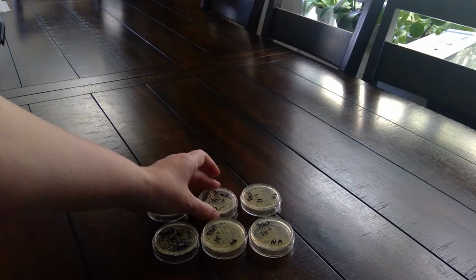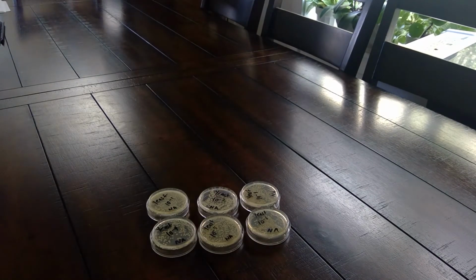Since these were inoculated twice, I would assume that the first time we wouldn't see growth because we weren't seeing growth after 2 days, but it's possible it was just slow because I also had to move my plates to a warmer part of my house. But I think the main issue was that the water that I used to activate the yeast wasn't warm enough. Just a reminder, you'll want to use your thermometer when you are getting water to activate your yeast. You want the water to be between 40 and 45 degrees Celsius. For me, the hottest my tap water got was 38, so I had to microwave some water and then slowly add cooler water until it came to 45 degrees Celsius.